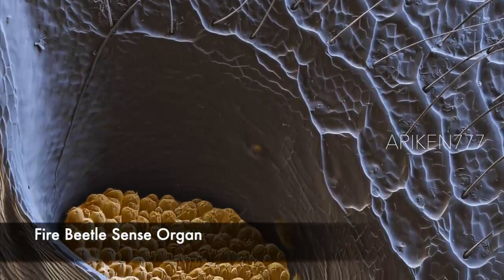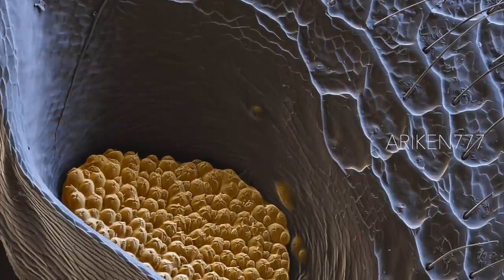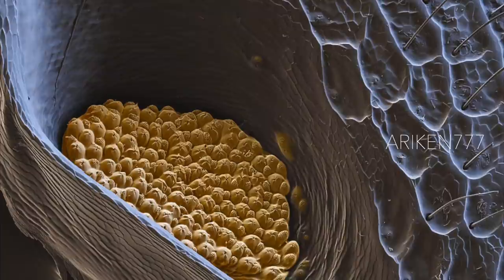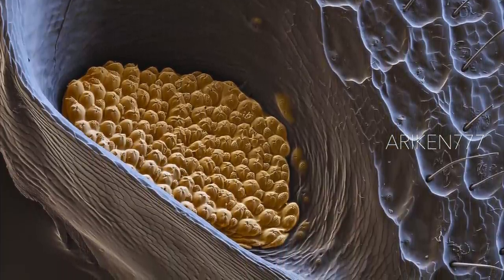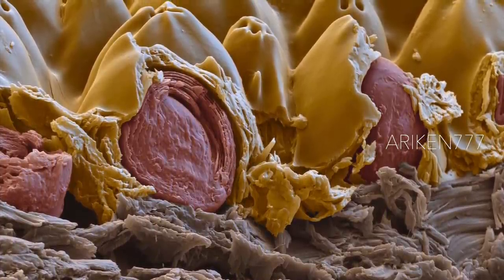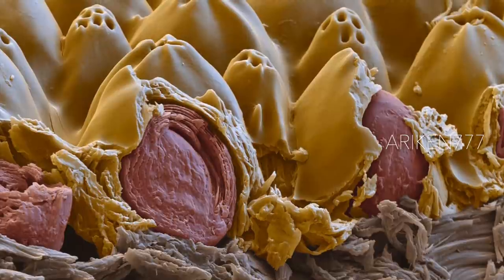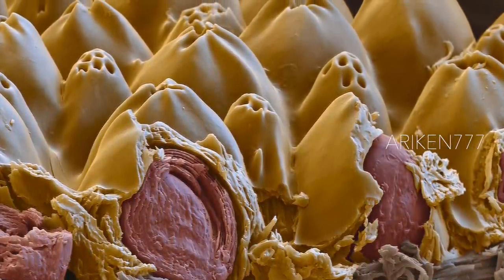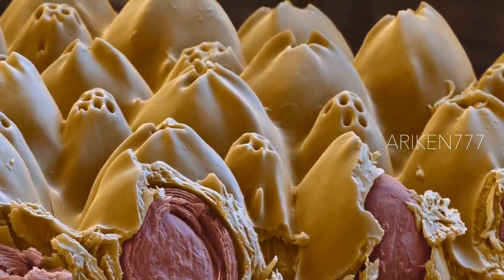The sensory organ of a female black pine jewel beetle that allows the beetle to locate radiation released during forest fires. The female beetles fly to charred trees to lay their eggs, and the larvae then develop undisturbed without competition from other species. Each sensor consists of a finger-shaped extension embedded in a cuticle ball filled with water. Infrared radiation from the fire hits the cuticle and the water expands, and the resulting increase in pressure is transmitted to mechanoreceptors. This image shows one of the two sensor groups located on the ventral side of the beetle.